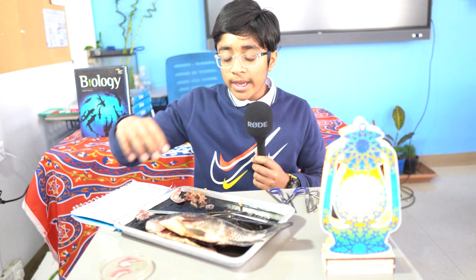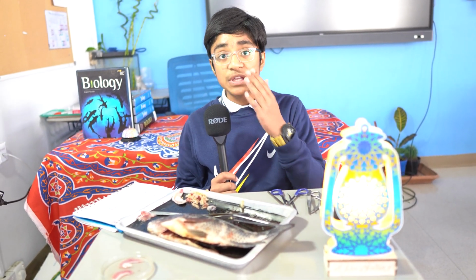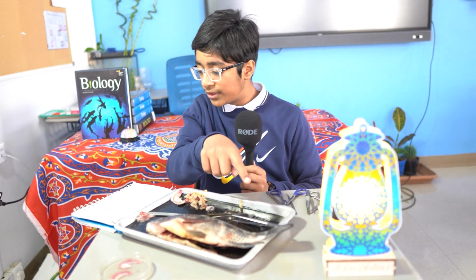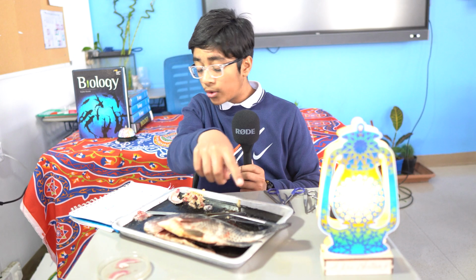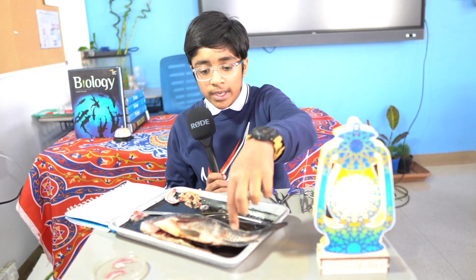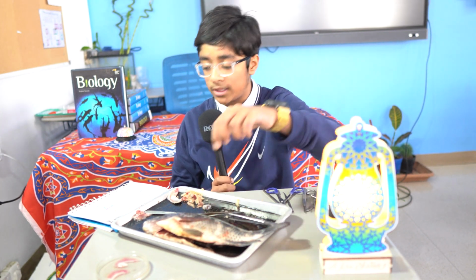within the fish. And the fish is also equipped with a wide range of fins that help it to swim in the water. These include the dorsal fins at the top, a lateral line, the lateral line is for sensing currents, while there is also a caudal fin, an anal fin at the bottom, there's a pectoral fin over here, as well as a pelvic fin at the bottom.